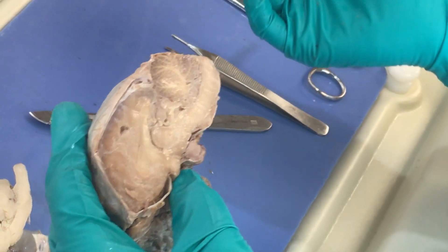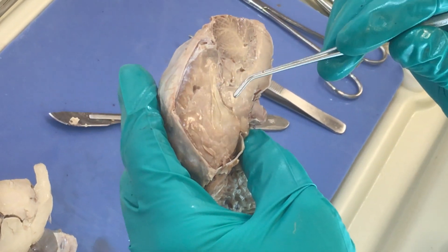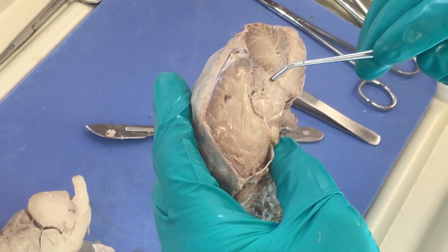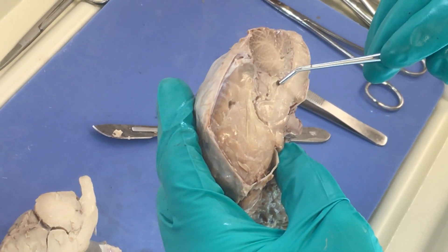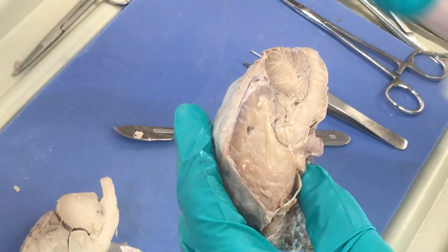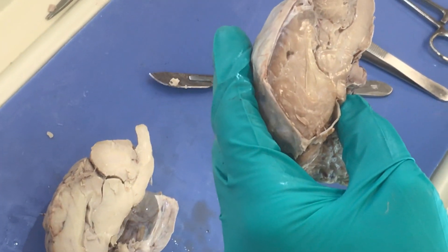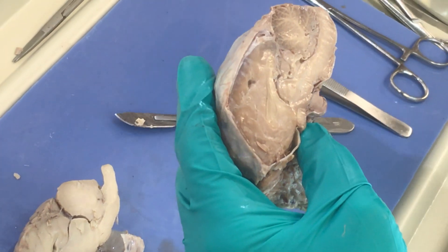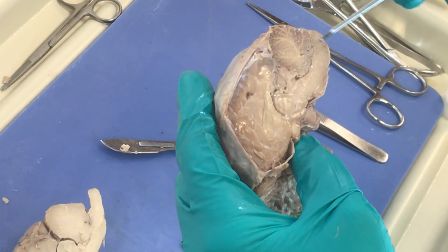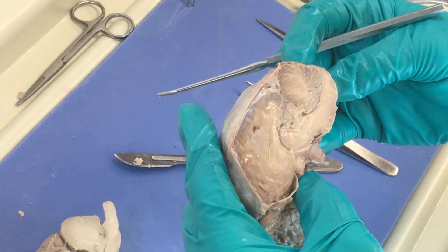The ventricles are important structures. We have our lateral ventricle up in the cerebrum — there's one on each side. We have the third ventricle here, and the fourth ventricle is right in this area connected to the third. There will be connections to the subarachnoid space up and around the brain itself, and then of course to the central canal and around the spinal cord. This allows cerebrospinal fluid to flow all in and around our central nervous system structures.